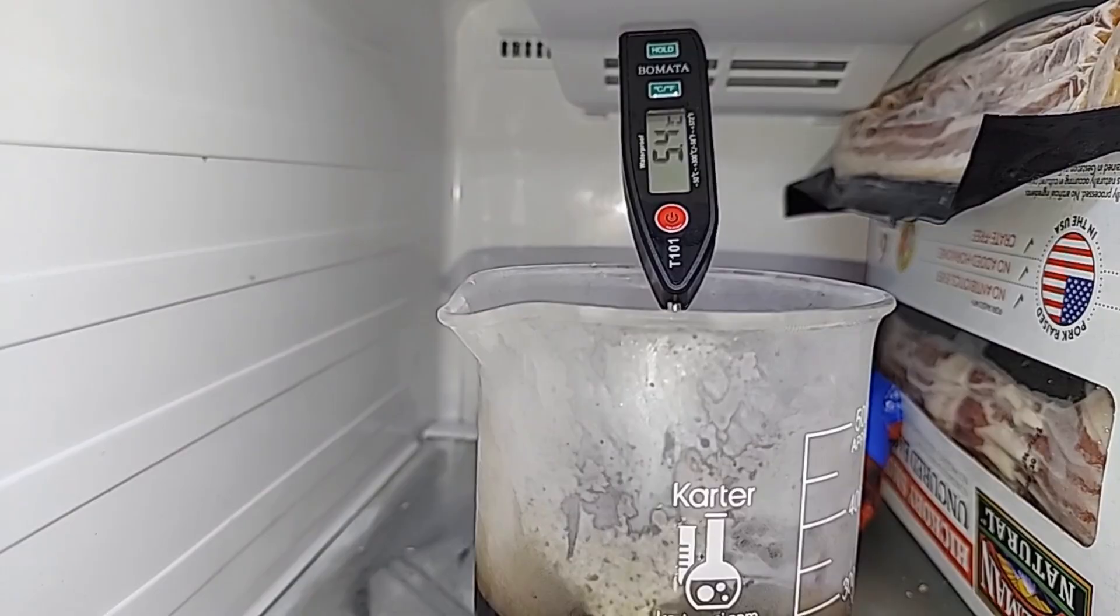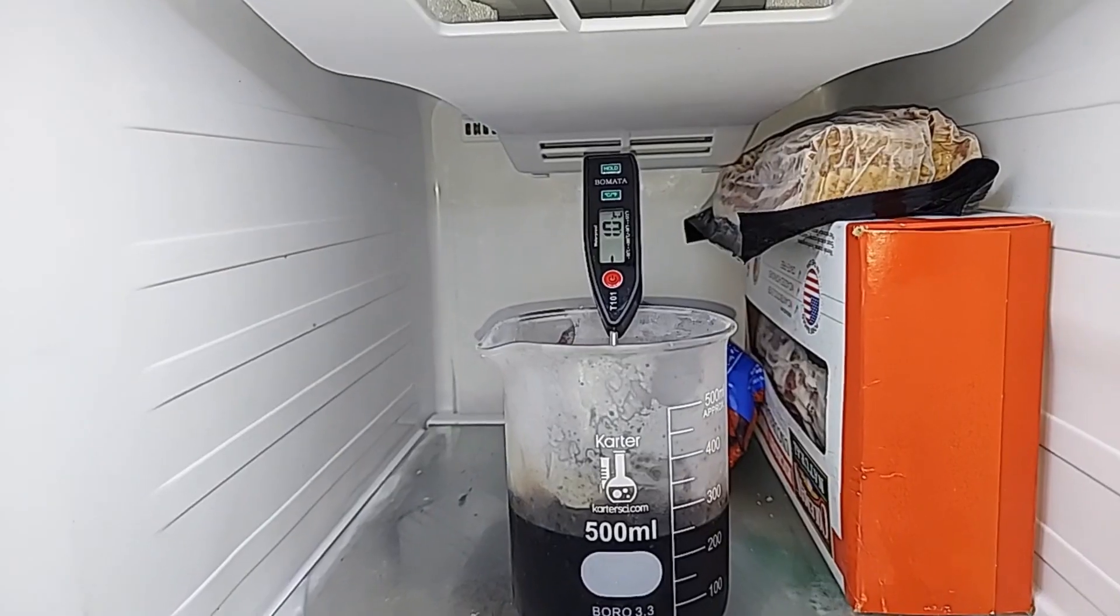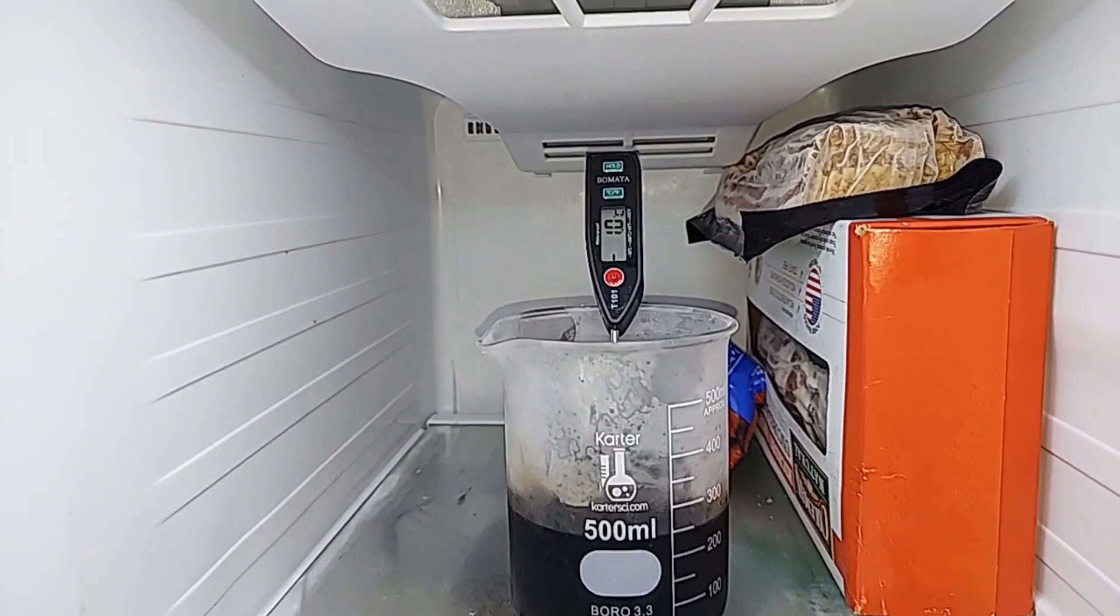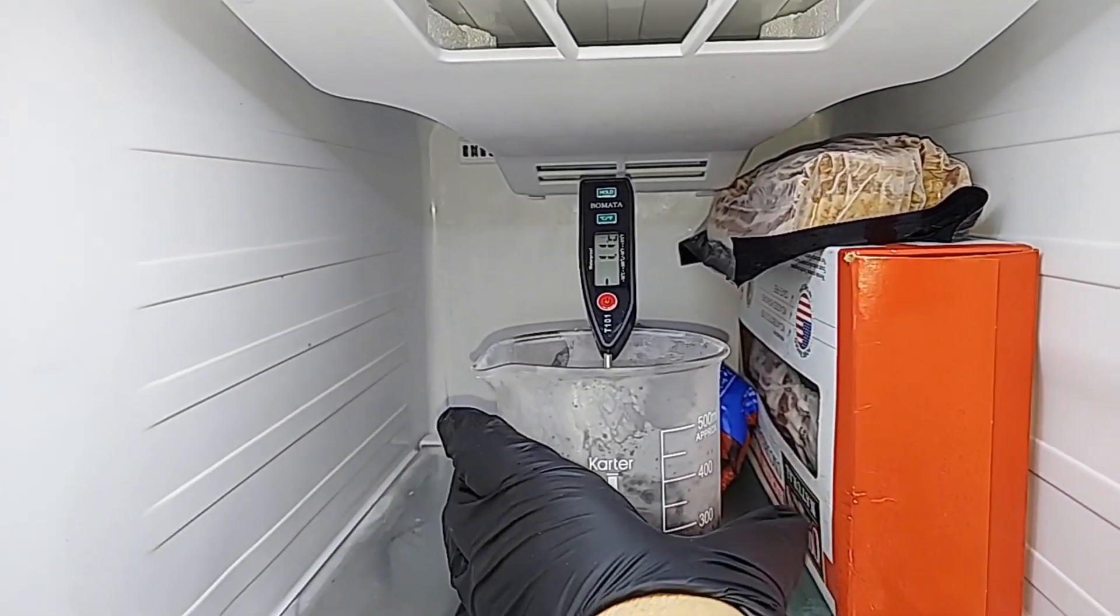After stirring, it's 5.4 degrees Celsius. We're getting there. We're at negative 1.1 or 1 Celsius. Obviously, it's not a big deal, so I'm going to grab this and let's go filter it.